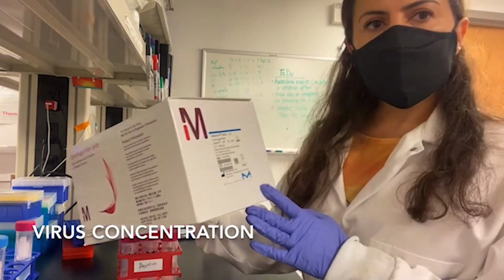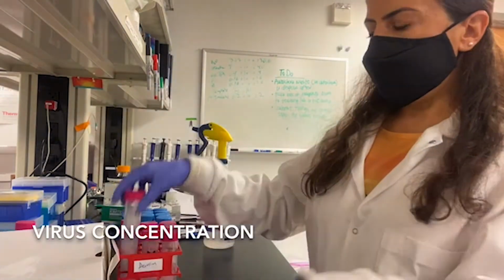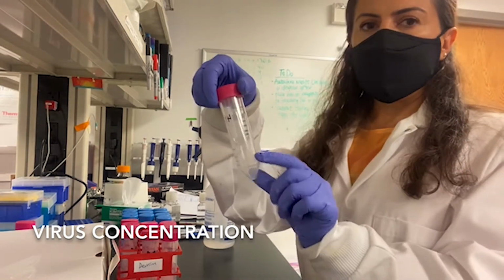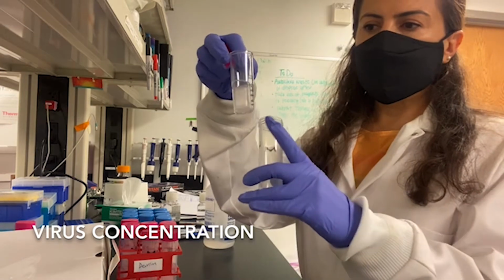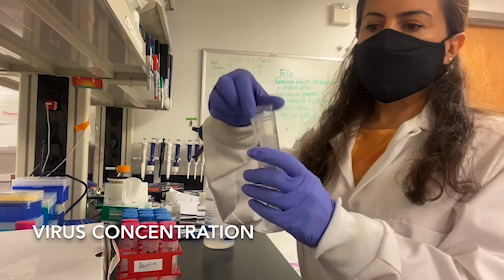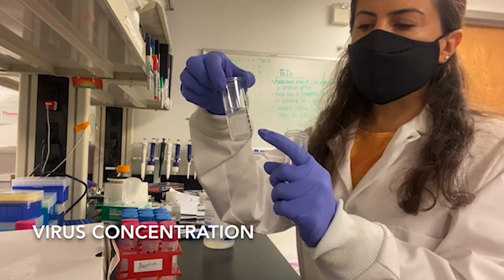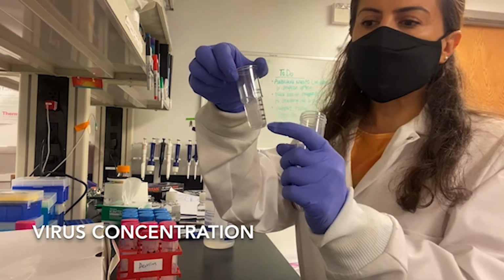I'm going to use this to concentrate my wastewaters. It comes in 2 units, and this is the collection part, and inside it has the membrane filter. You put your water here and then centrifuge this, so your wastewater virus particles or the RNAs and all the genetic material, proteins, are going to concentrate in this vessel.